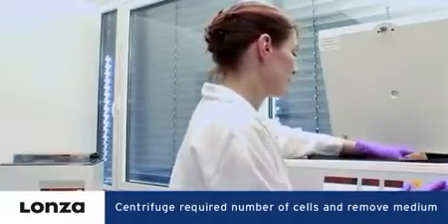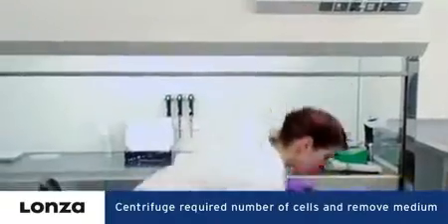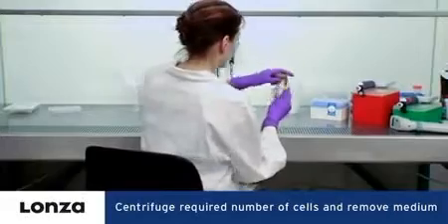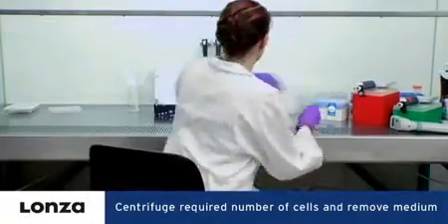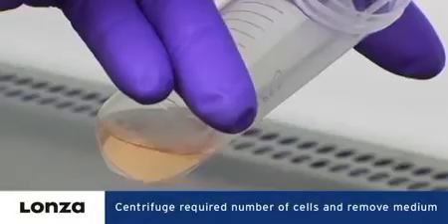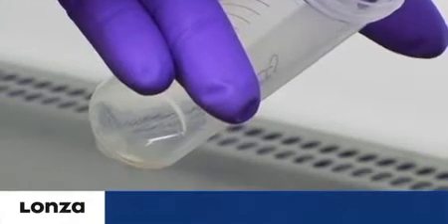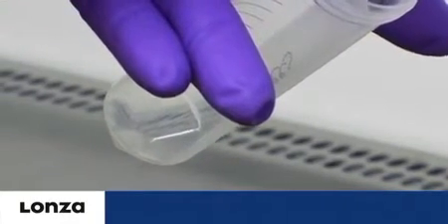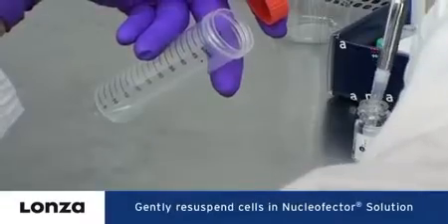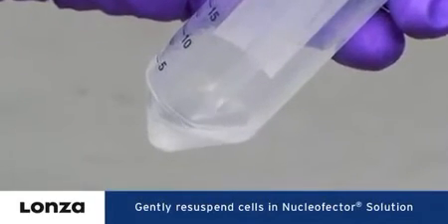The cells required for all samples are prepared according to the optimized protocol. Possible void volumes should be taken into consideration. After the centrifugation, the cell culture medium has to be removed as carefully and completely as possible. The cell pellet then has to be gently re-suspended in the supplemented 96-well nucleofector solution.